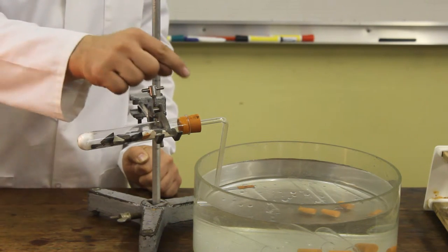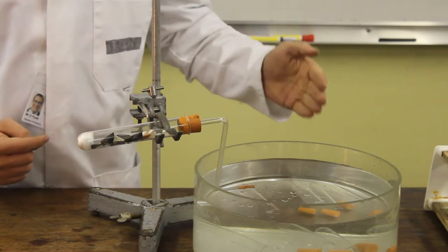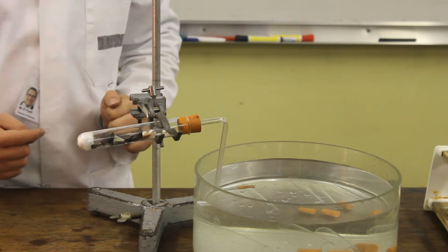Connected to the boiling tube, we then have a delivery tube which is underneath some water. And inside the water, we have some test tubes and we're going to collect the product.